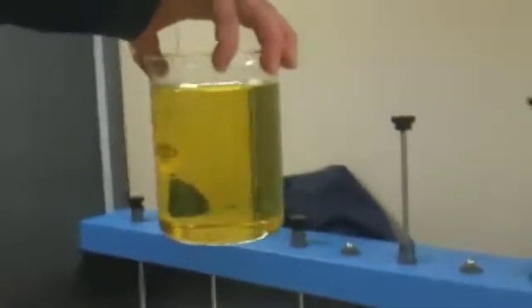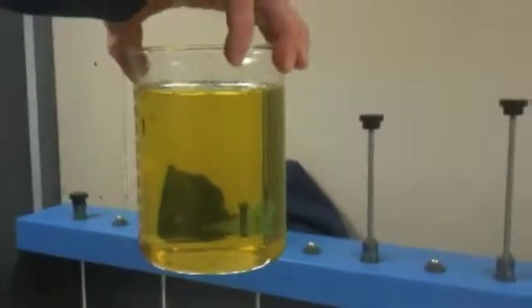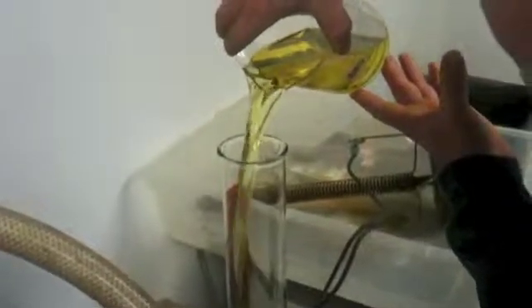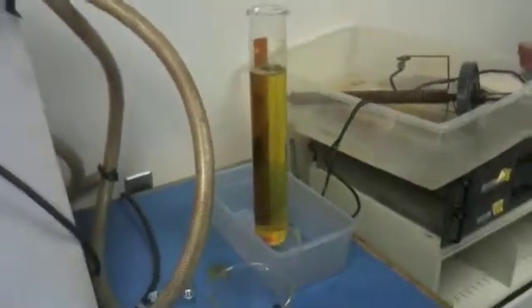Welcome to another demonstration of electrocoagulation. My name is Juan Carlos Herrera with Clean Environmental Solutions. This sample contains about 200 parts per million hexavalent chromium and is about to be treated by electrocoagulation.